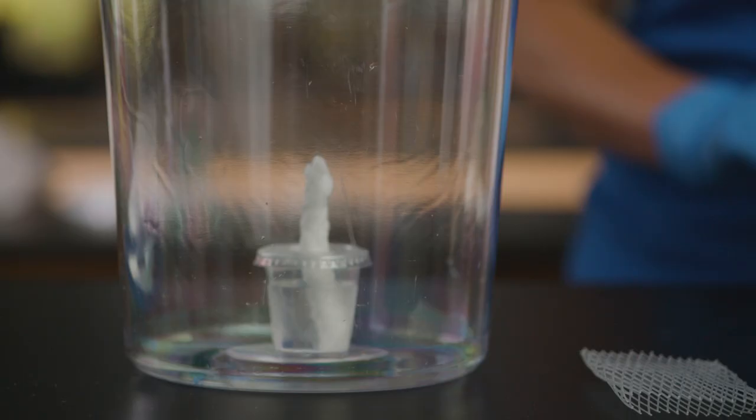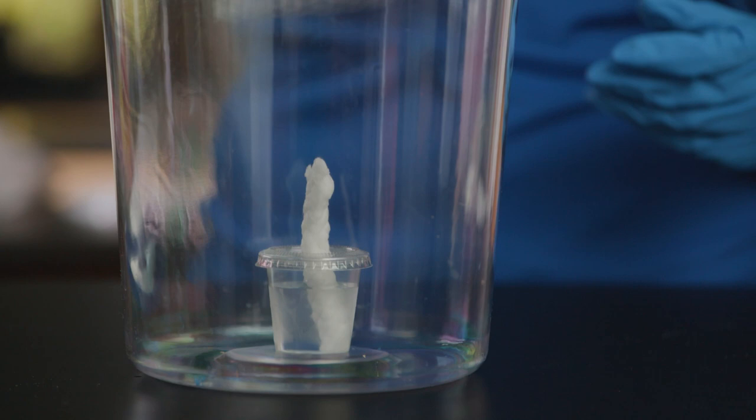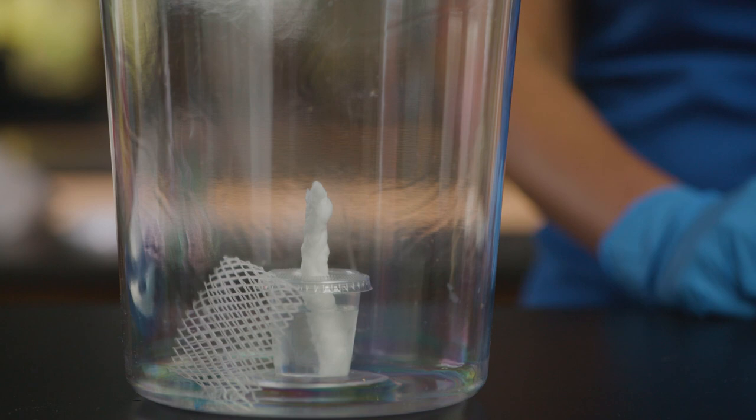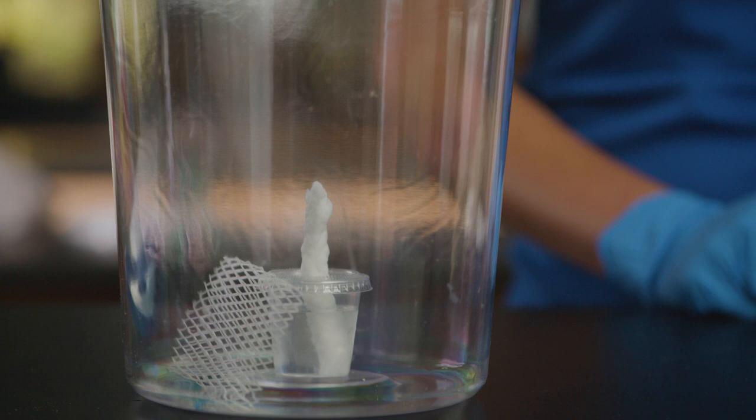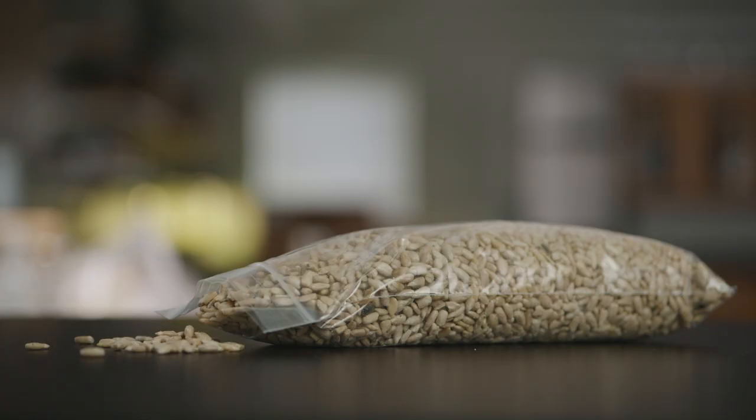Provide your bugs with a place to climb and hide. Carolina culture kits come with a climbing net, but wadded paper or towels can be used too. Lay the netting or paper towel against the water cup in contact with the water cup so that the bugs can use it to climb to the water.